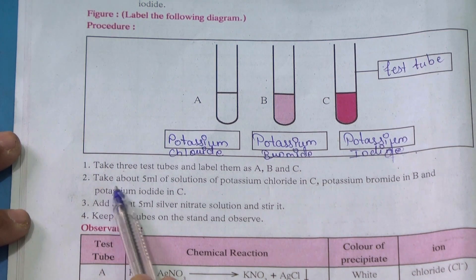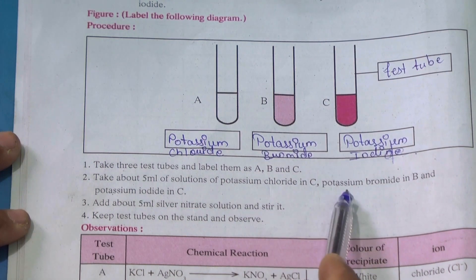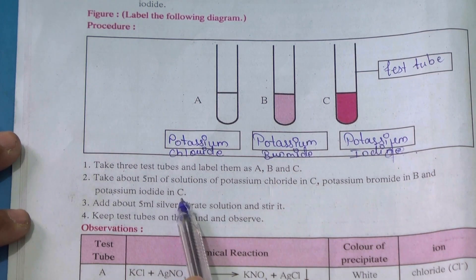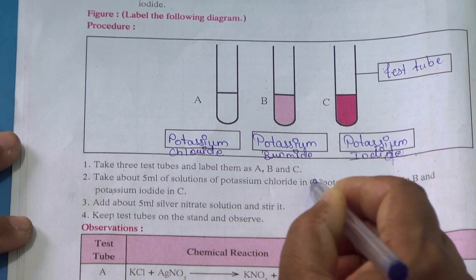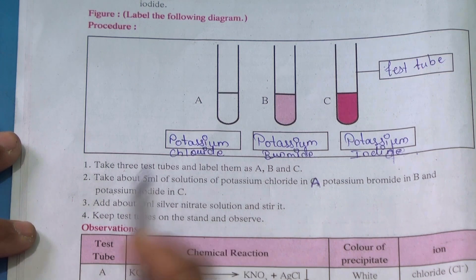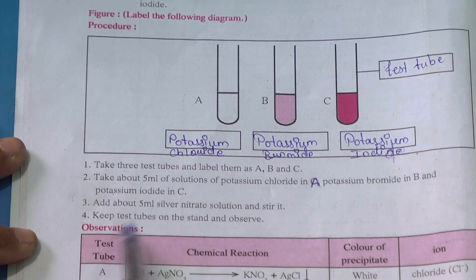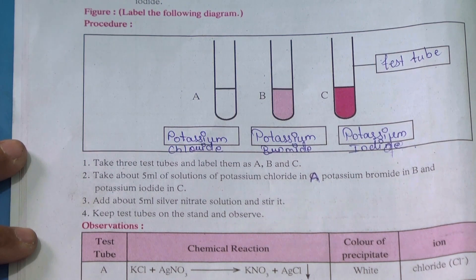We have taken 5 ml of solution — potassium chloride in A, potassium bromide in B, and potassium iodide in C. Then we have to write down the observation as per the observation table, whatever we will observe.